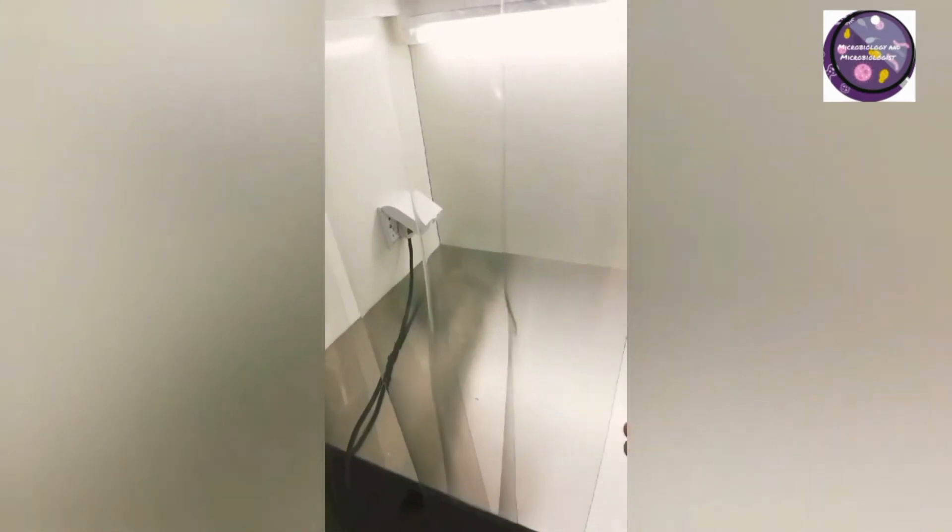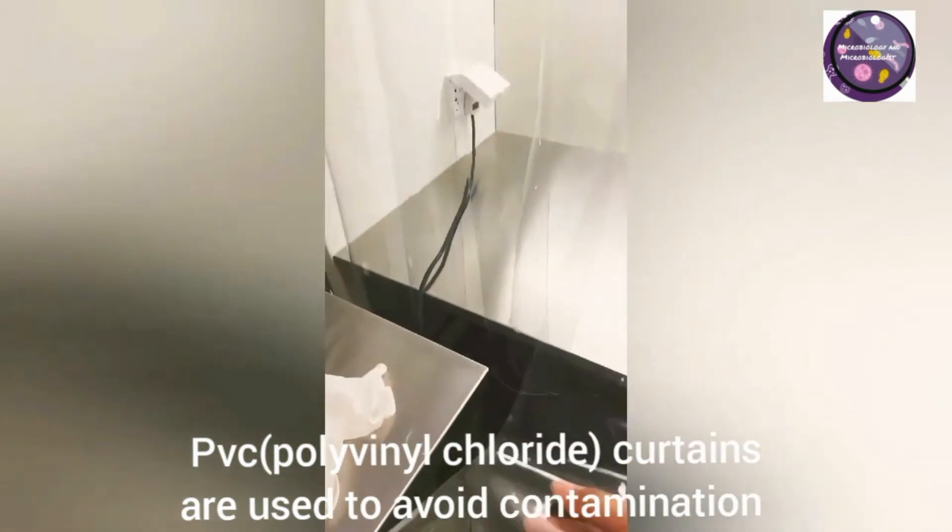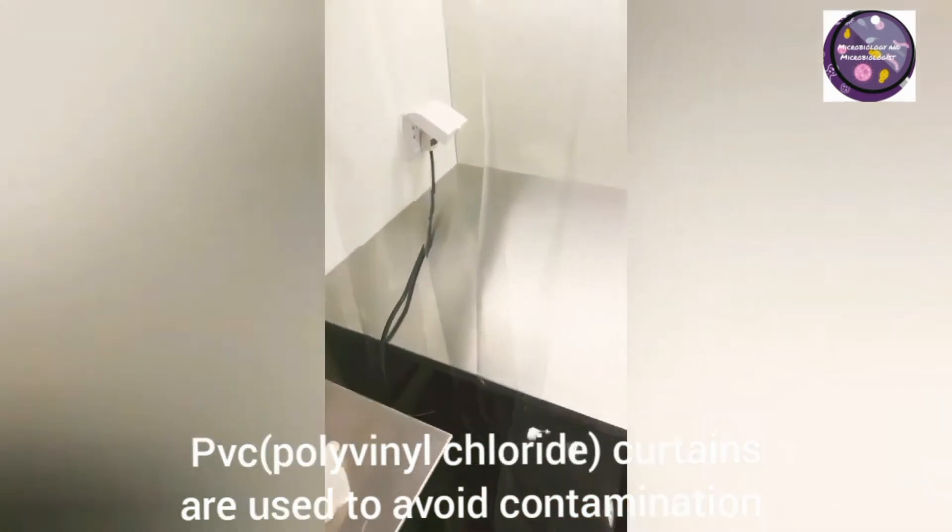These are PVC curtains, and these PVC curtains are important to control cross-contamination. Class A surroundings must be of Class B.